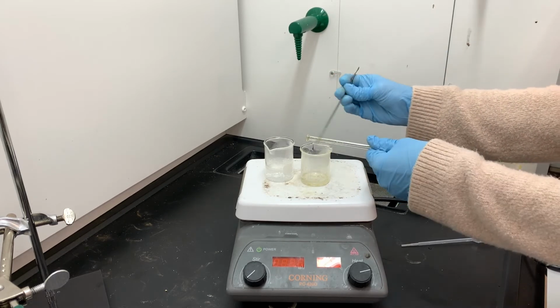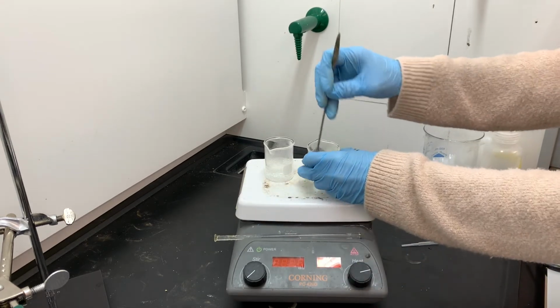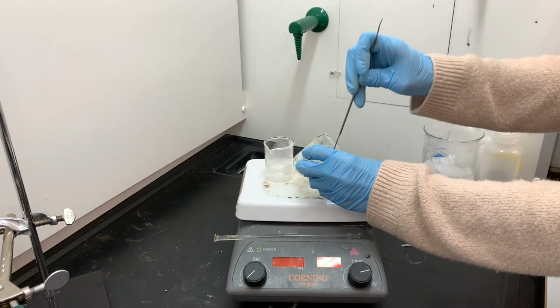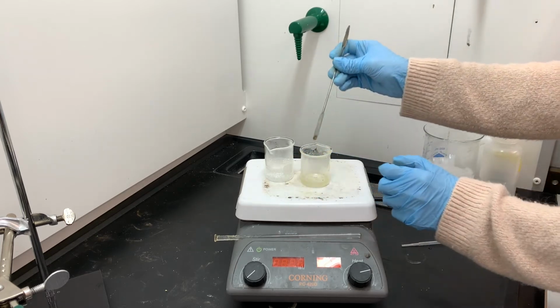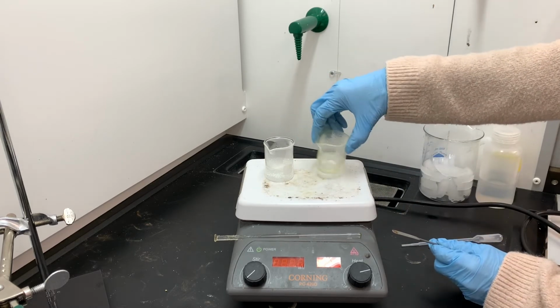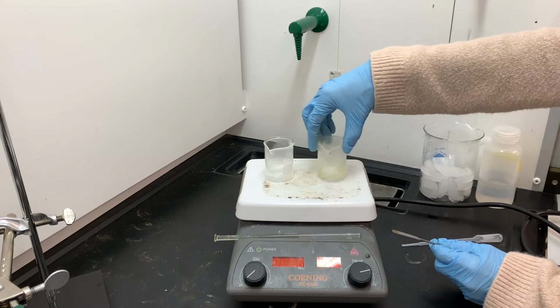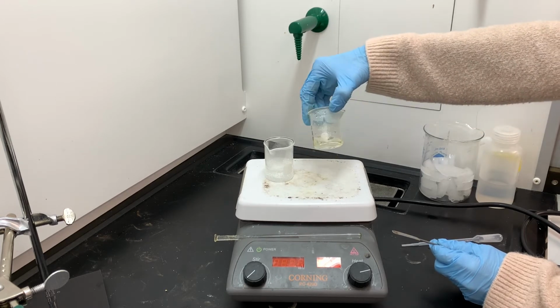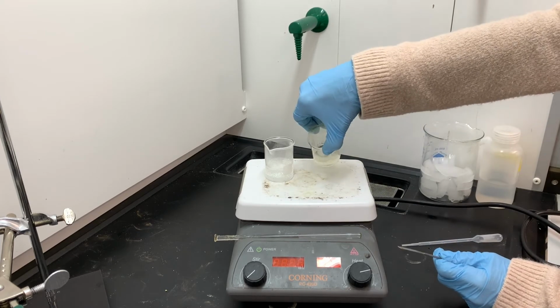Normally we don't have to do these types of things in the recrystallization process because normally we're working with a large enough quantity of product that it's okay for us to leave stuff stuck to the inside of the beaker or leave stuff stuck to the stirring rod or to the metal spatula. But in this situation, because we are only synthesizing a teeny tiny amount of product, we can't afford to leave anything behind. It's looking pretty clear. The beaker is looking pretty clean.